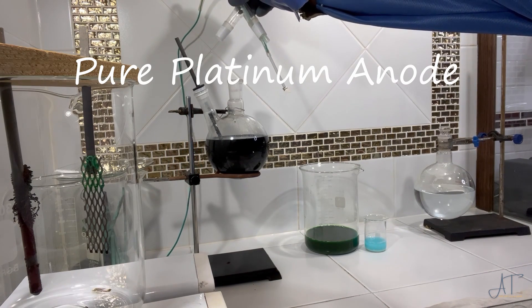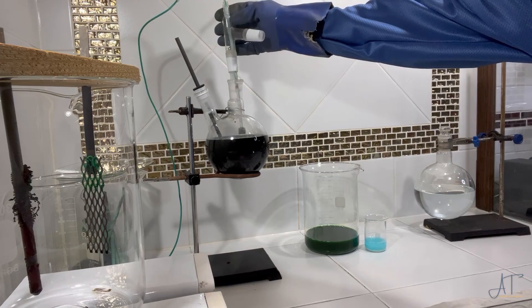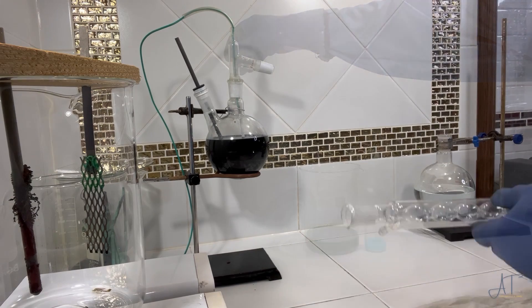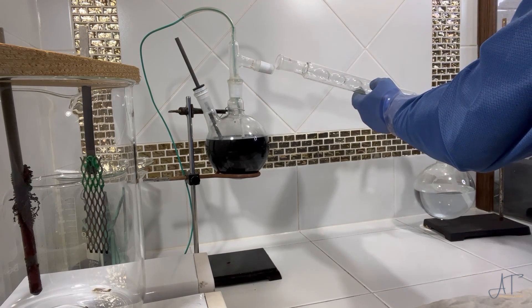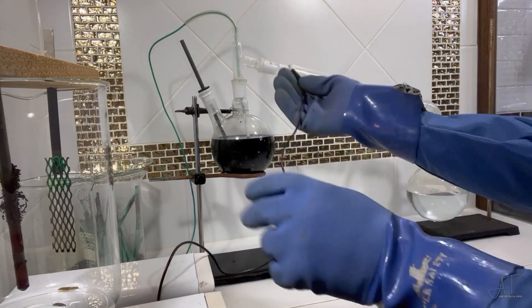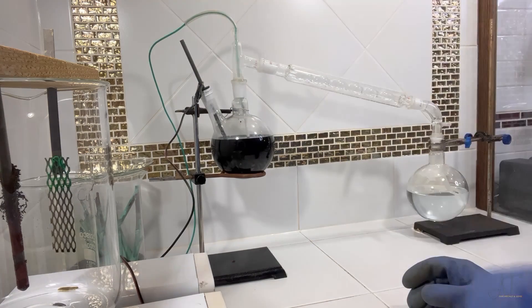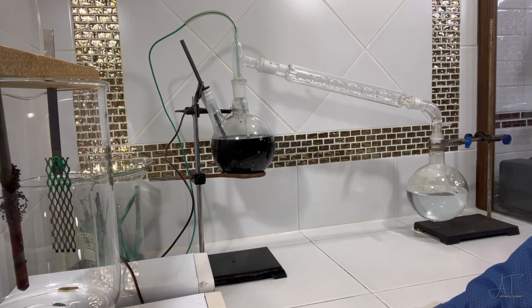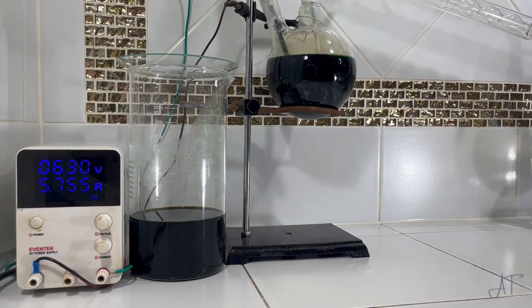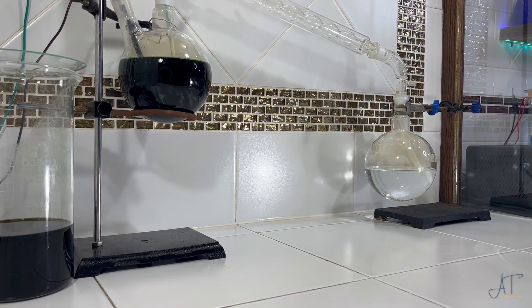These gases are run through a flask of water on the receiving end. Since chlorine is semi-soluble in water, it increases the potency of the acid. Hydrogen is barely soluble in water, so it escapes through the discharge end of the setup — it could be captured, but the volume is really quite low. The acid that's generated is hypochlorous acid, similar to bleach, and works great as a disinfectant. But my favorite use is cleaning out that stubborn residue on all the glassware.